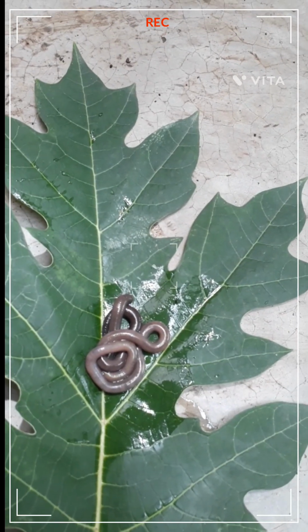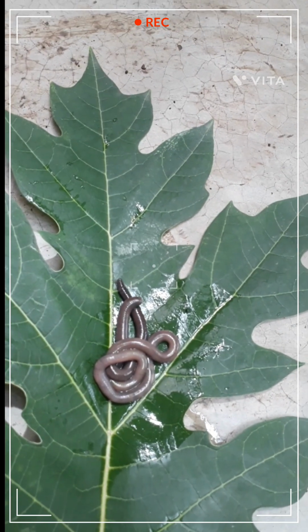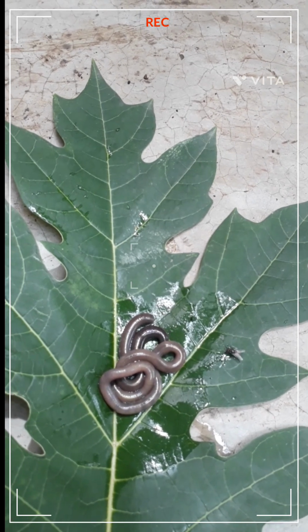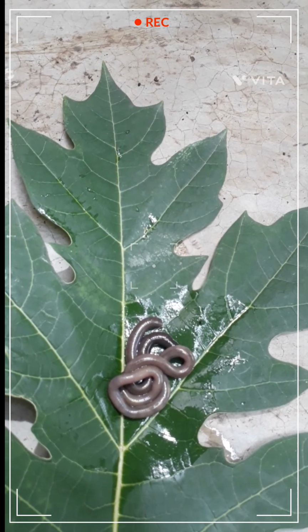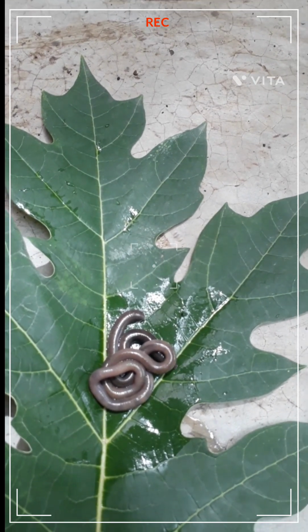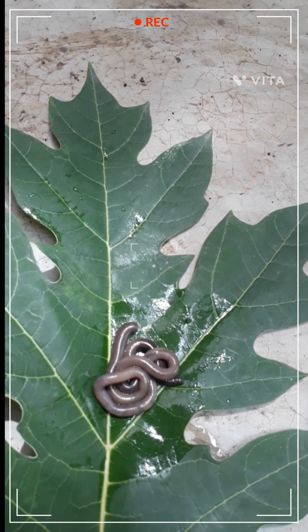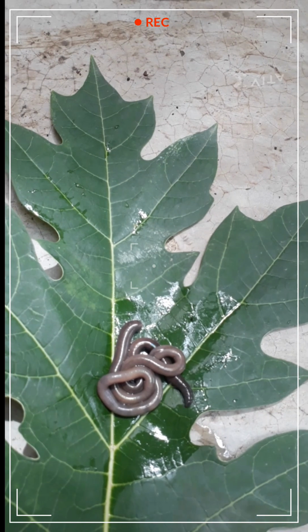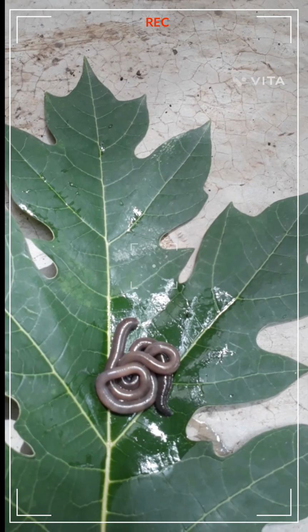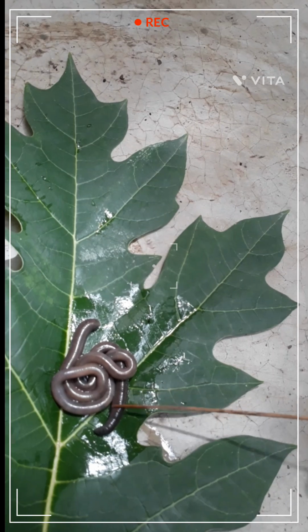Now we can see the excretory system of the earthworm. It consists of excretory organs occurring as segmentally arranged coiled tubes called nephridia. They are of three types: septal nephridia, integumentary nephridia, and pharyngeal nephridia. Septal nephridia are present on both sides of the intersegmental septa from the 15th segment to the last, and open into the intestine. On the phone I'm not able to show the segments.